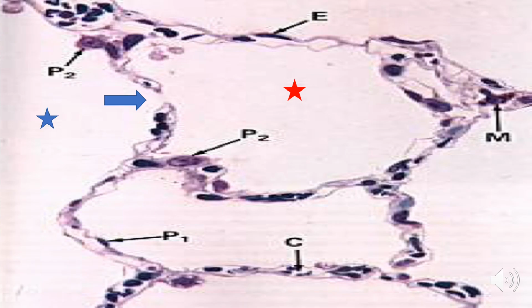The blue arrow is pointing to a pore that is present in some of the alveolar walls in the lungs. And these pores are called the pores of Kohn, and they function to connect neighboring alveoli that are supplied by different bronchioles. So expect that the alveoli with the blue and red stars have their own bronchioles supplying them with air. So what is now the importance of these pores of Kohn? Let's say for example, there's an obstruction in the bronchioles supplying the alveolus with the blue star. That alveolus will still receive air from the alveolus with the red star, even if they are not supplied by the same bronchiole.